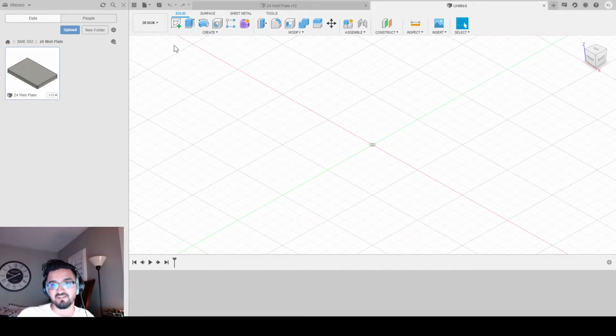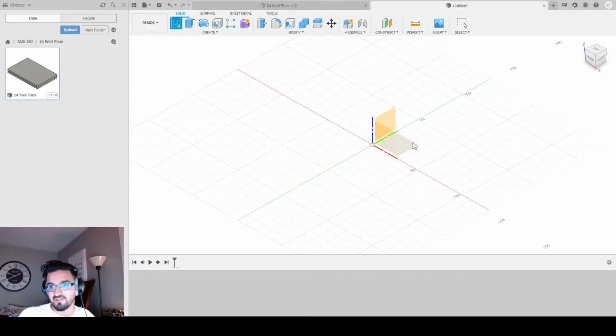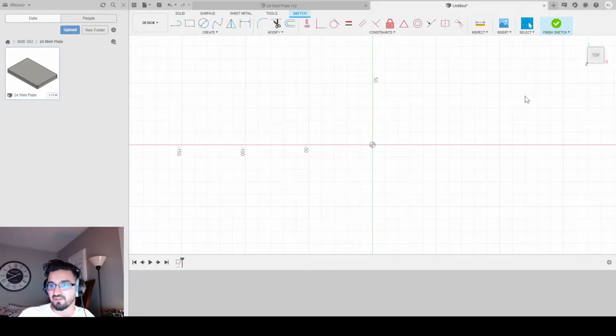Anyway, the first thing I like to do before I start anything is create a new component so I know what I'm building. And it's a good idea to get in the habit of doing this because when you have multiple components, you know what's what. So this is my plate component, and I'm going to create a sketch on the X and Y plane. I know I'm in the X and Y plane because this is the top, here's my X, here's my Y, and the Z is coming toward me. Z is at the corner here, that means it's facing me.